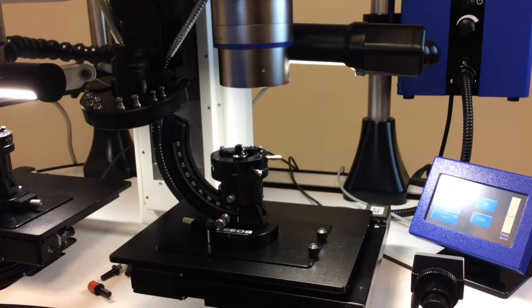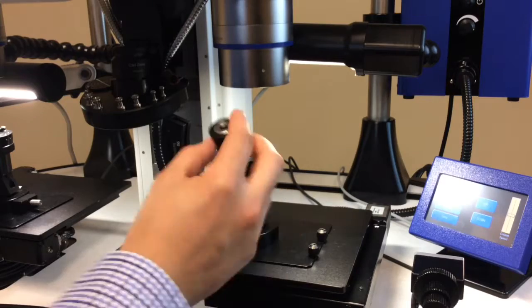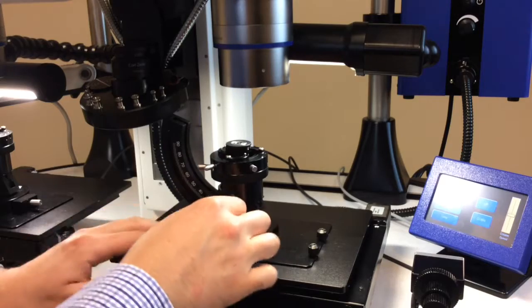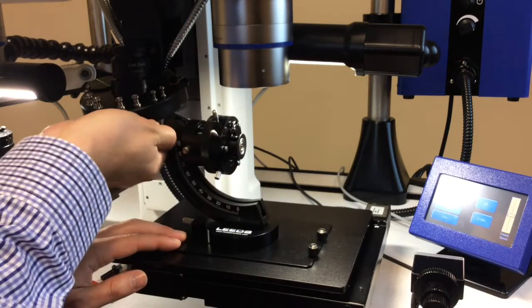So the first thing we're going to do is take our on-center holder insert and place that into the universal holder. Make sure it's tight. Next we're going to go ahead and bring it up to 90 degrees and lock it in place.